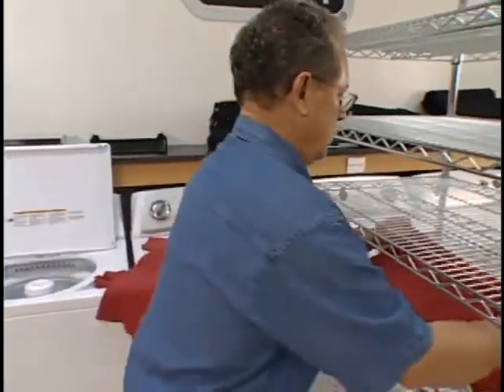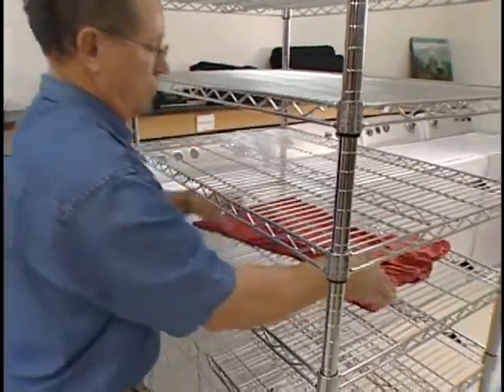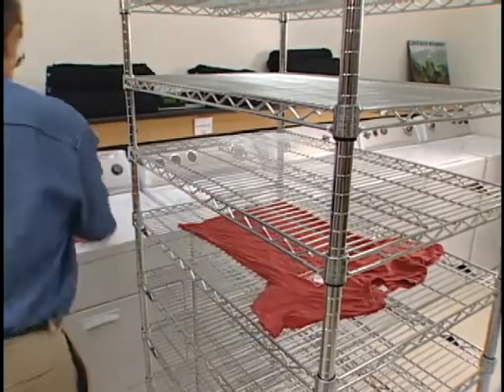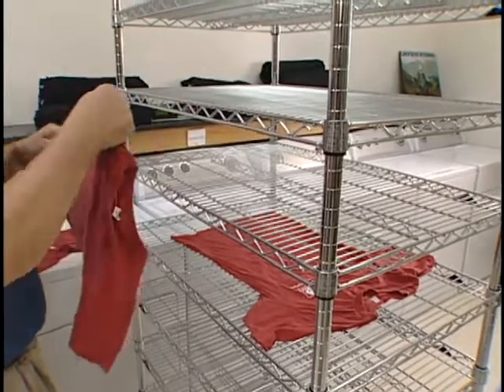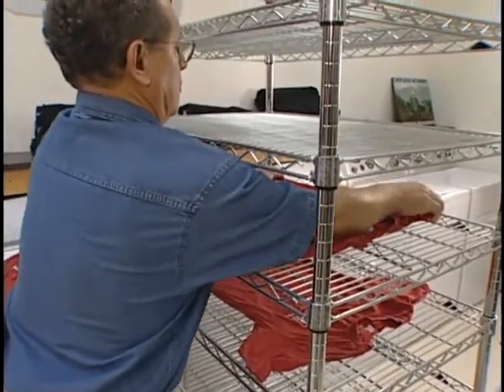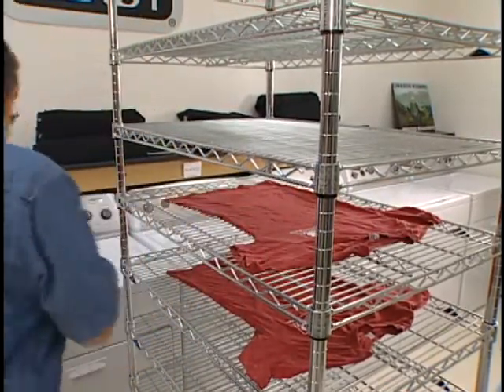Screen or flat drying is often specified for heavy sweaters and dresses that would be likely to elongate if hung to dry. Spread each specimen on a horizontal screen or perforated surface, removing wrinkles but not distorting or stretching the specimen. Allow the specimen to dry in still air at room temperature.